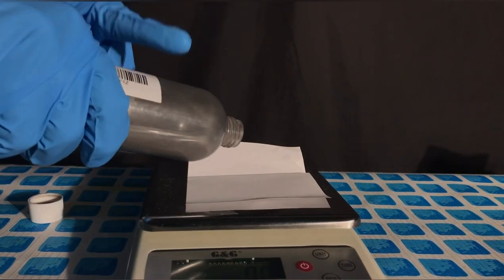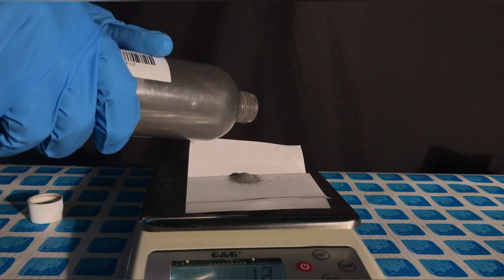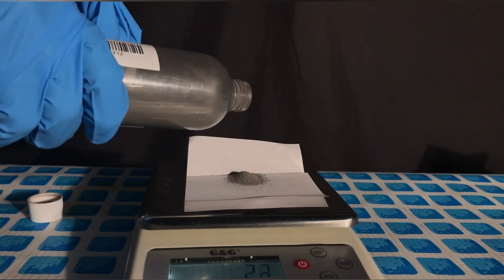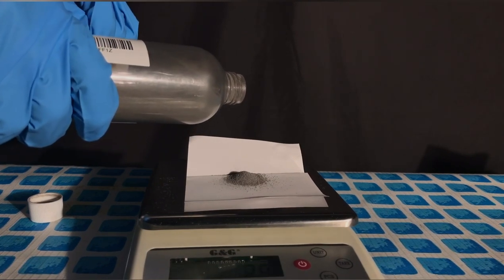3 grams of iron powder were weighed out. This was my initial decision, but later on I decided to add much more.